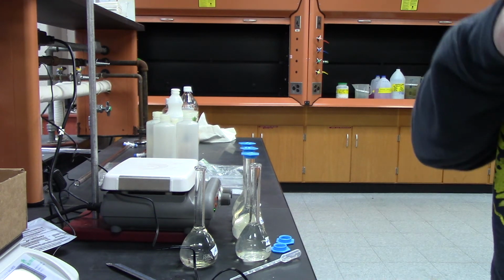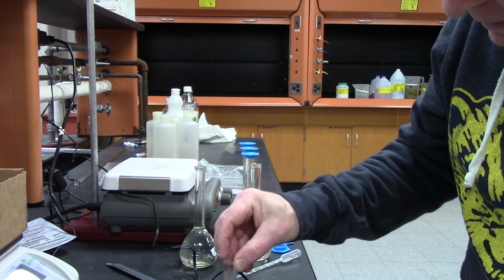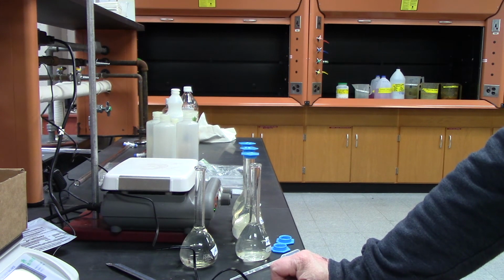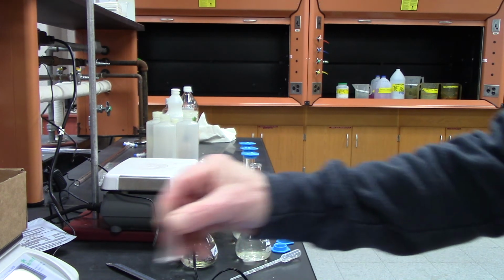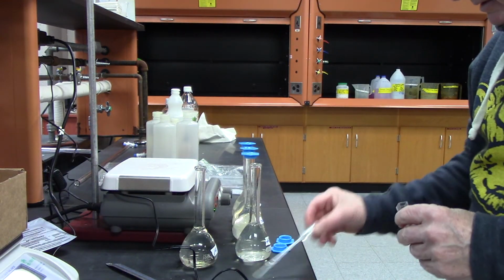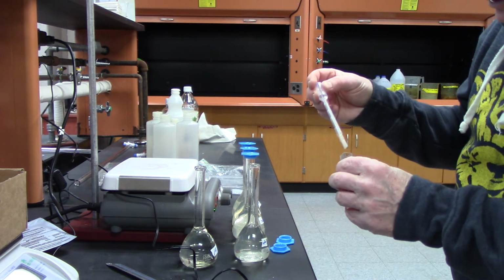Whoops, what are you doing? Okay, now it's changed. I don't like that, so I'm going to redo this one. Now it said 0.02.